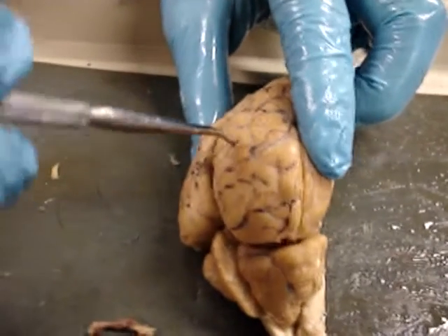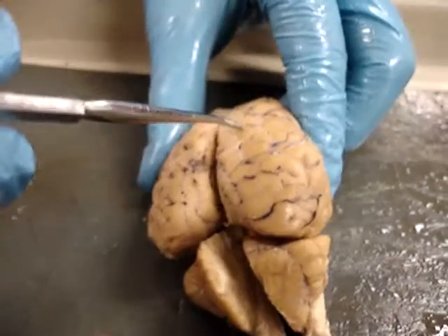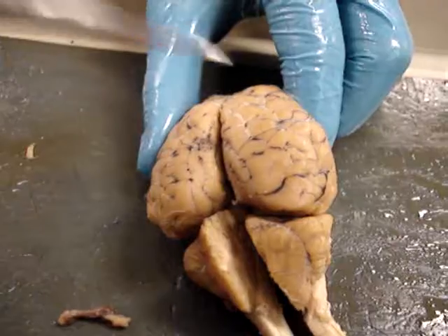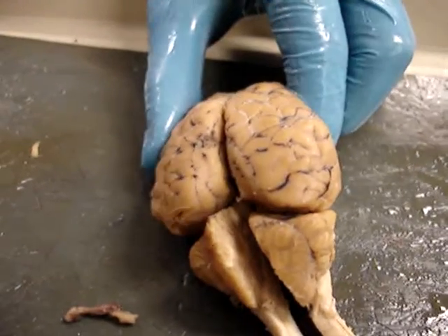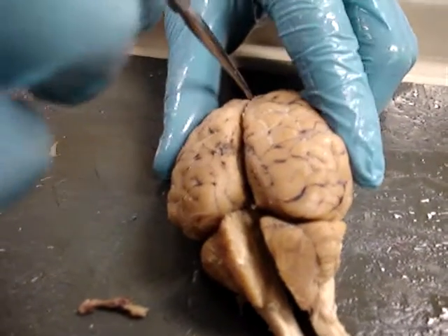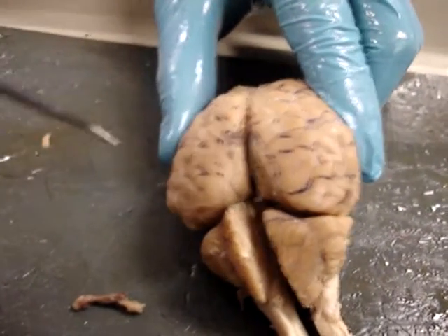The sulci are all the indentations, and the gyri are all the bumps. The median sulcus goes right down the middle of it.